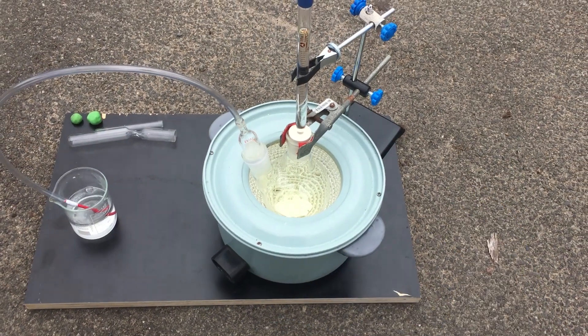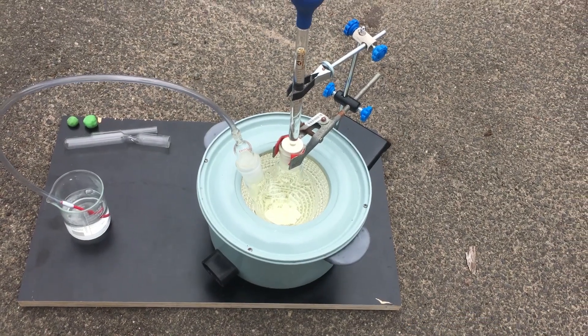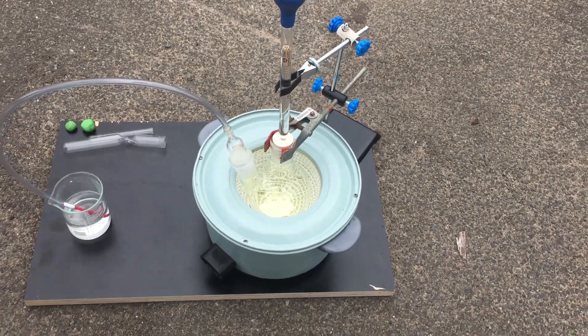Oh yeah, by the way, the heating mantle here is just to hold the flask rather than actually provide heat. We don't need any heat to drive the reaction forward.